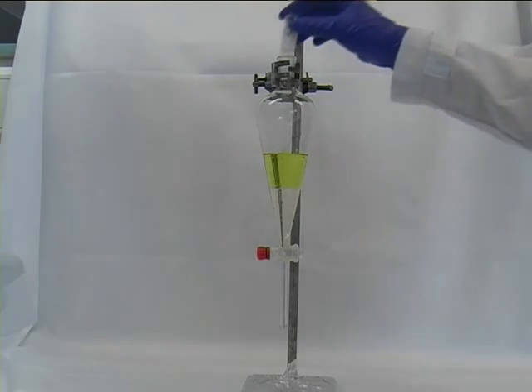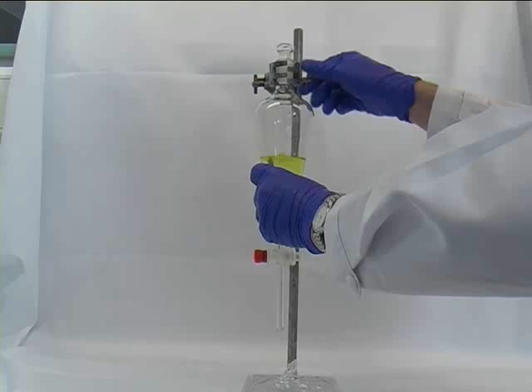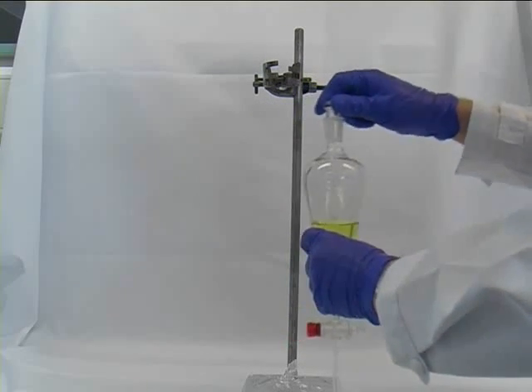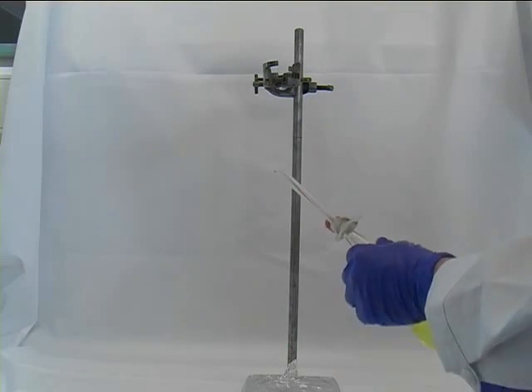After you have removed the funnel, stopper the separatory funnel and hold the stopper firmly in place while you turn it over.